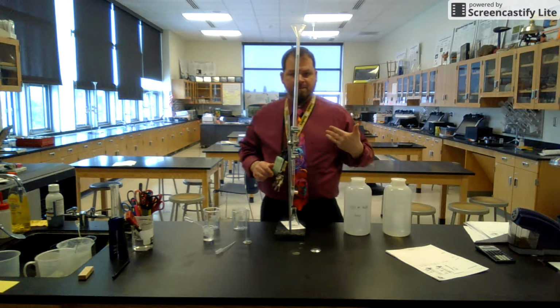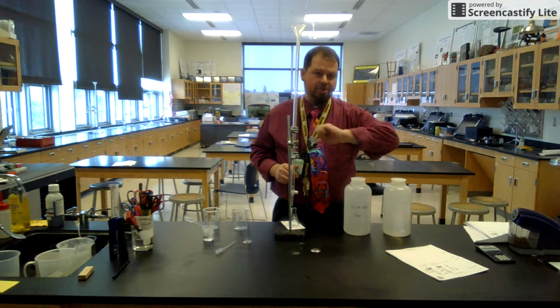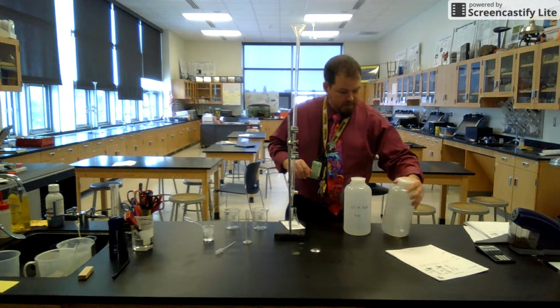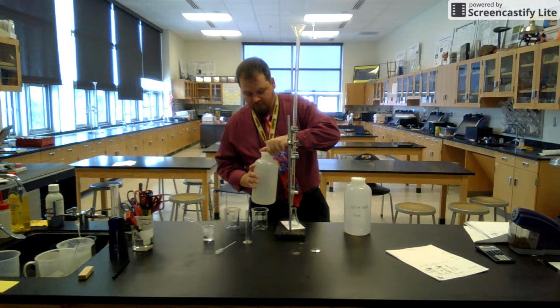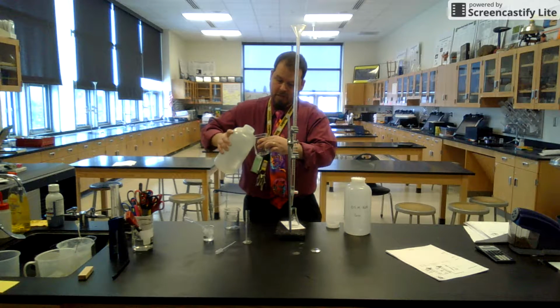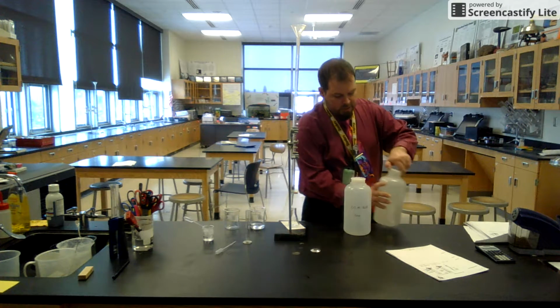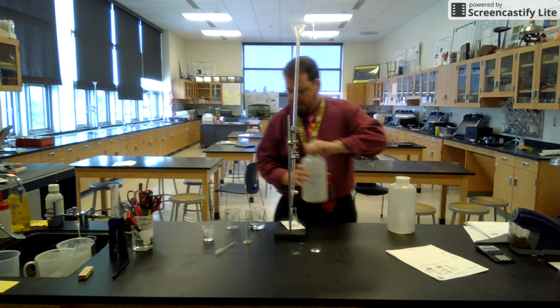When you come to see Mr. Milks, show me that your background, your purpose, and your procedure are all set. I will give you acid and base in a beaker. I'm only going to give you about 40 mils of acid because you're going to titrate 10 mils at a time. About 10 mils at a time. So there's the acid. You're going to need a little bit more base because we're going to titrate this thing 3 times.